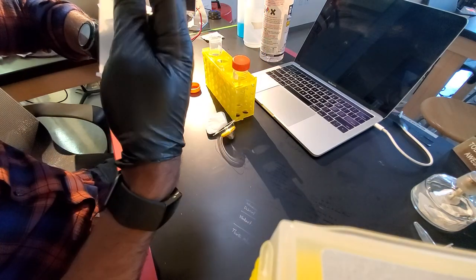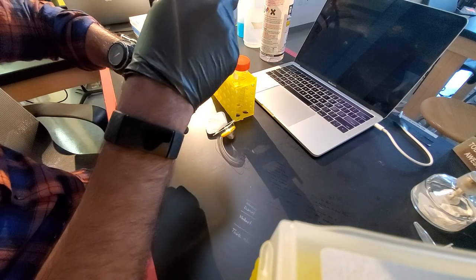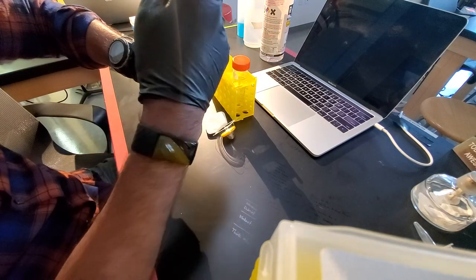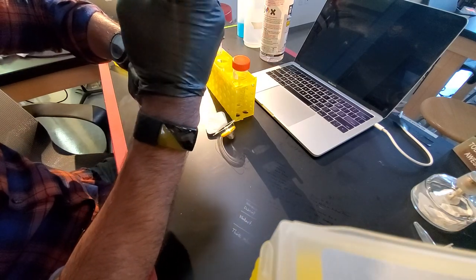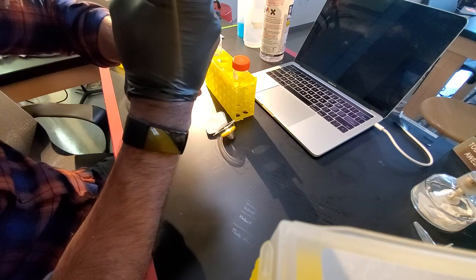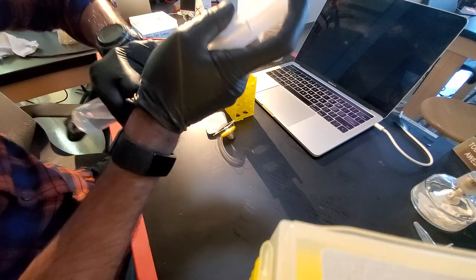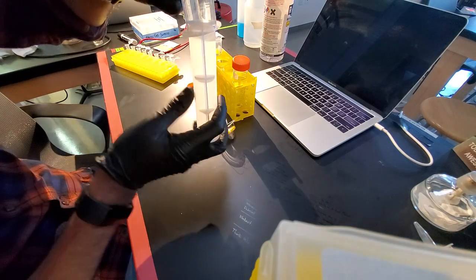All right. Then here's kind of the tricky part. I have to put this in, but if I put this in too hard right now, it's going to blow the solution out on my thumb. So I'm just going to kind of wedge it in there just a tiny bit, and then I'm going to invert the whole thing. Okay.